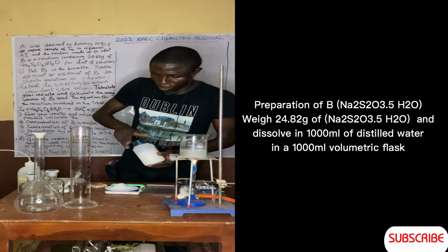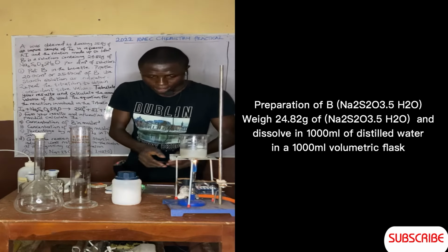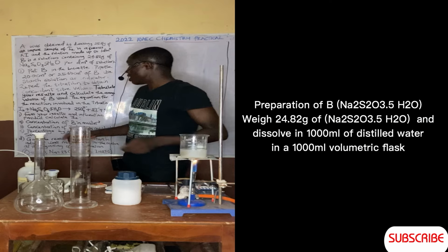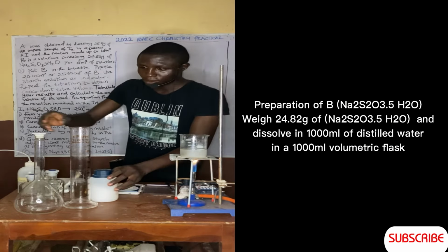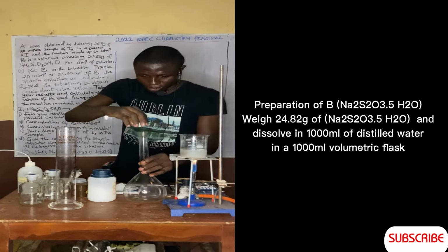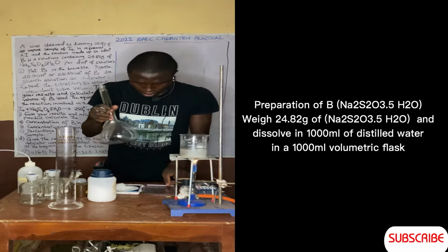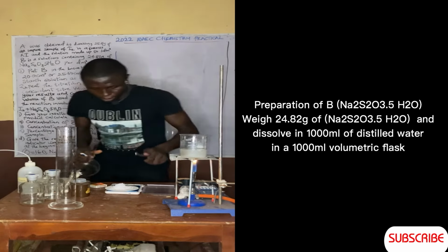So we are going to dissolve this 24.82 grams inside what? Inside 1000 ml of distilled water. So here you have to be careful so that you don't lose this, because this is a little bit much substance. So you take it gradually.